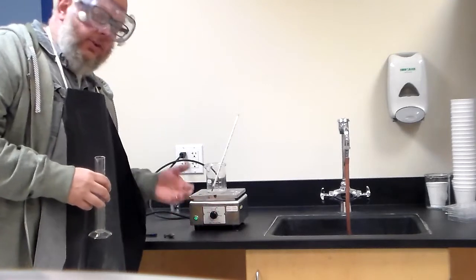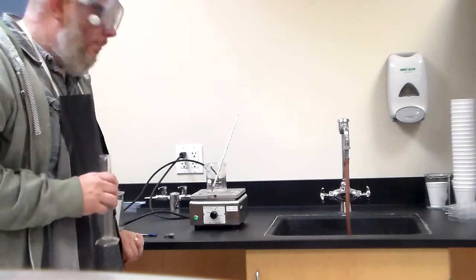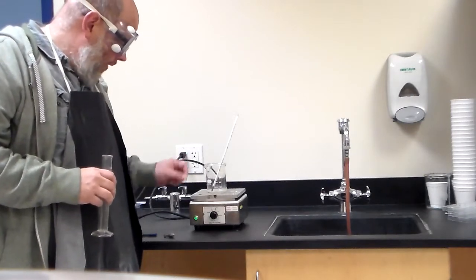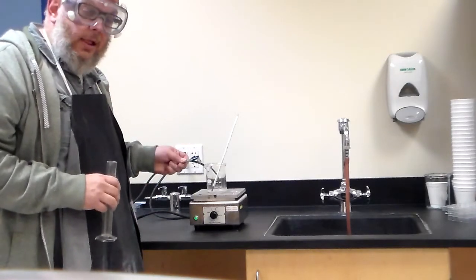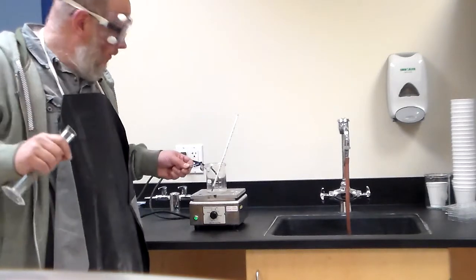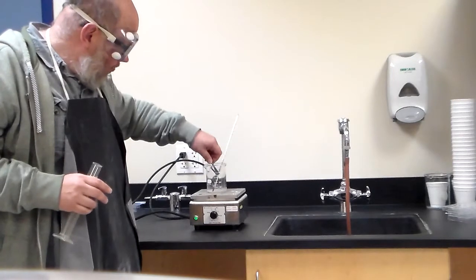Now, the idea about this is that we want the water to boil pretty rapidly. I'm going to try to heat up the water before class, but the idea is we want the water to heat up fairly rapidly. What we want to do is take that piece of metal. Now we can weigh the metal, that's not a problem. And we've got our balances over there. So then once it's weighed, you can take it and you can put it in here.